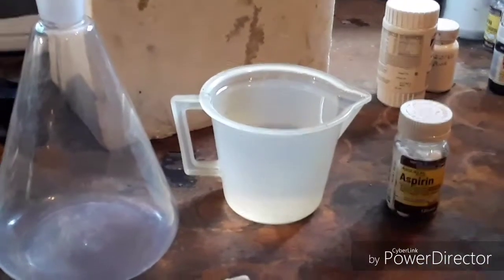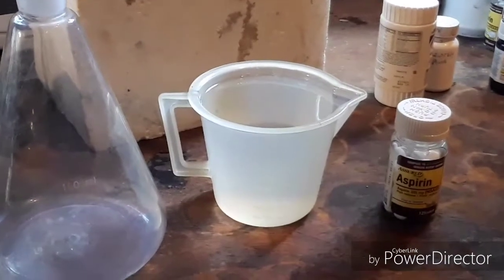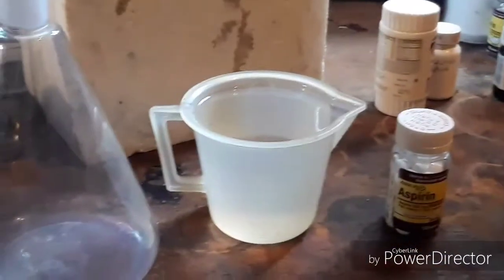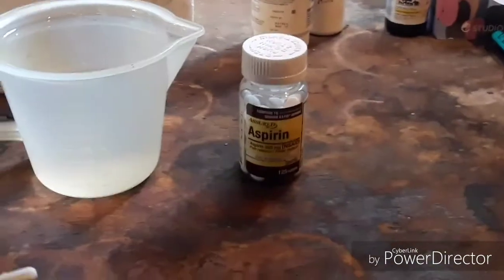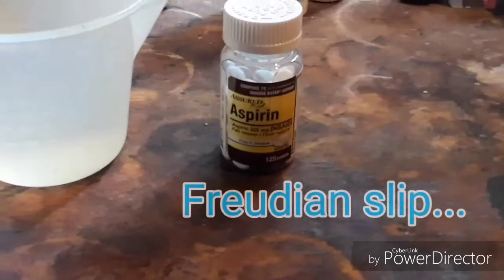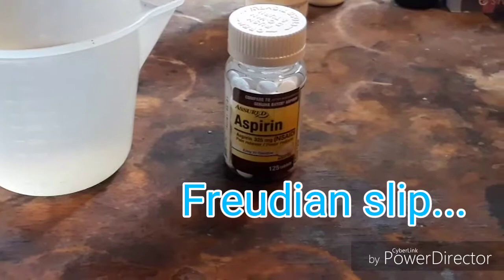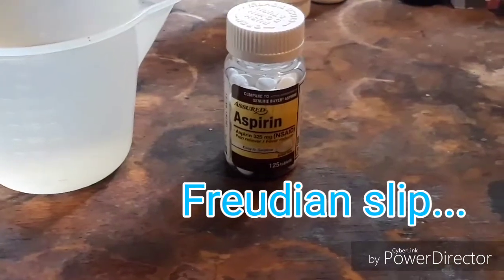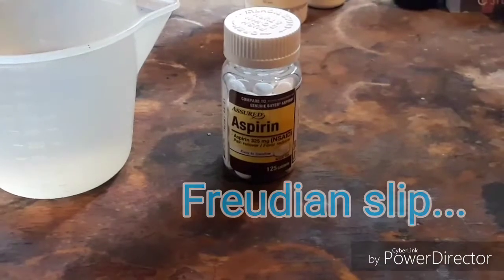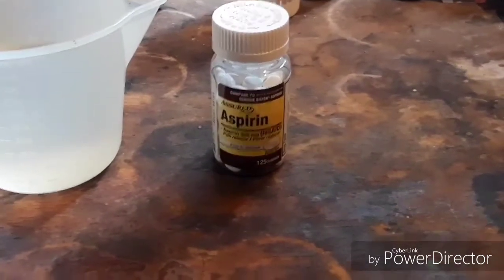Welcome back to Chaos Chem. Today I'm going to be showing you how to obtain ASA — otherwise known as salicylic aspirin... I'm looking at the word aspirin, so I say aspirin. What I mean is, we are going to show you how to obtain pure acetyl salicylic acid, otherwise known as ASA.